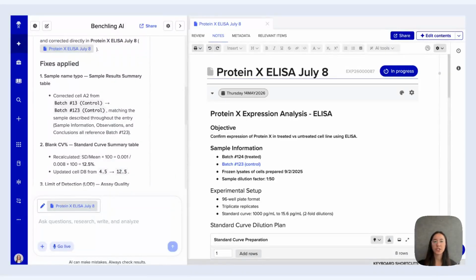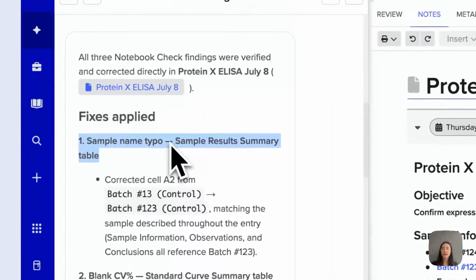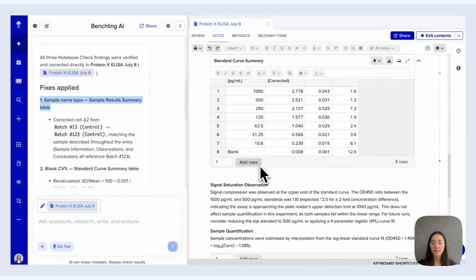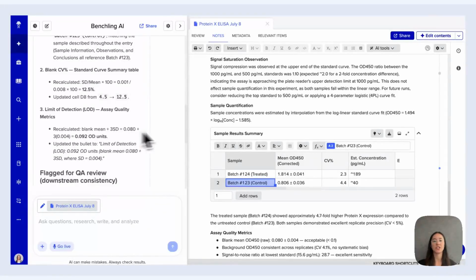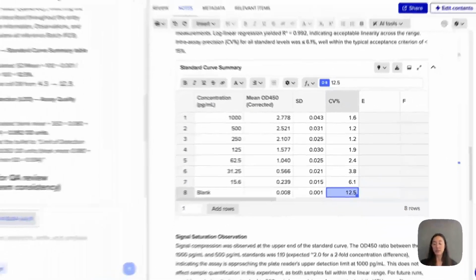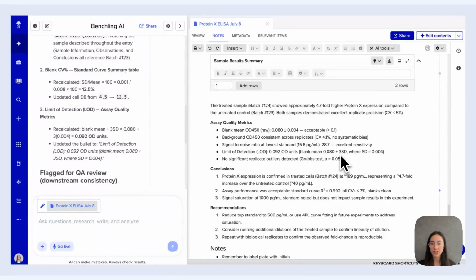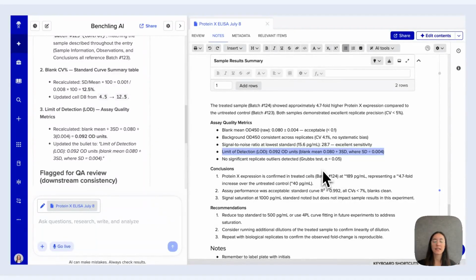All right, so Notebook Check suggestions have now been applied by our chat agent. You'll see that the agent then provides a summary of the fixes that were applied on the left-hand side. So let's go ahead and quickly check through those. The first suggestion we applied, or we wanted the agent to apply here, is to correct the batch number in the sample results summary. If we scroll down to that, you'll notice that that batch number has now been corrected. That's great. Now let's talk about the blank CV and the limit of detection calculations. If I go back up to the CV here for the blank, you'll see that that has also been corrected, which is great. That's what we wanted as well. And then last but not least, the limit of detection. If I scroll down to that calculation here, you'll see that that has also been corrected. So these are all changes that have now been applied directly to my notebook entry, so I can then do any final checks that I want to do before I send this off to my manager for review.